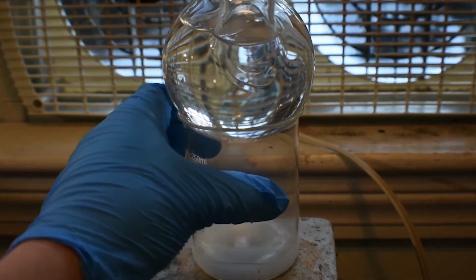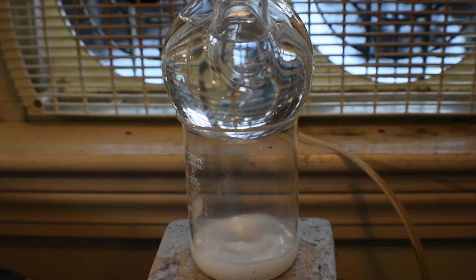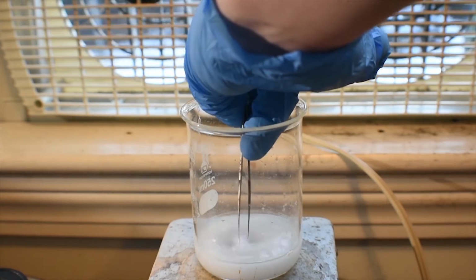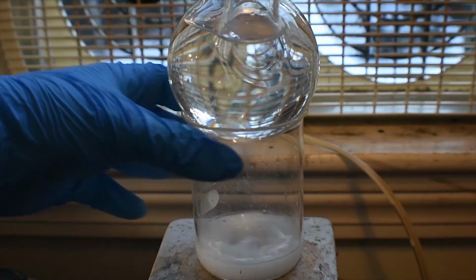And as this heats up, all the inositol pretty much will dissolve, leaving us with a practically clear solution. Oh my, there's a hair in there or something. God damn it, that's going to annoy me. I got to remove that. Hang on. Get out of there. Alright, well, that's all done.